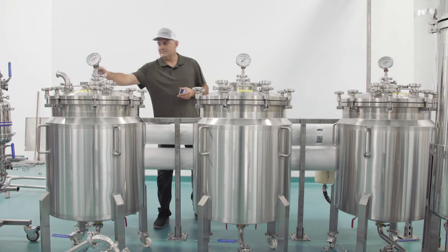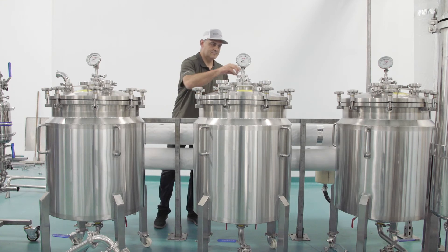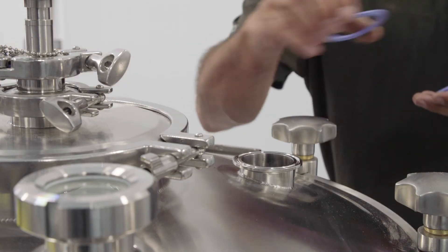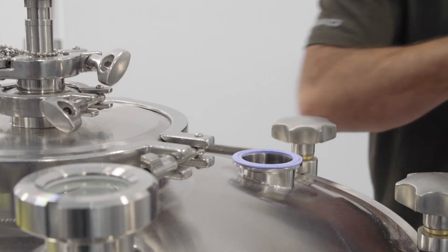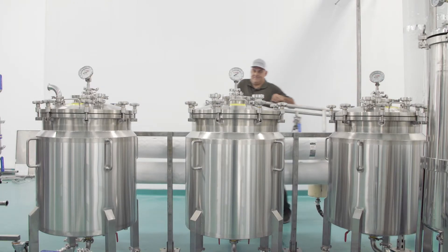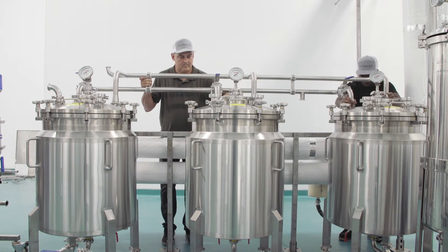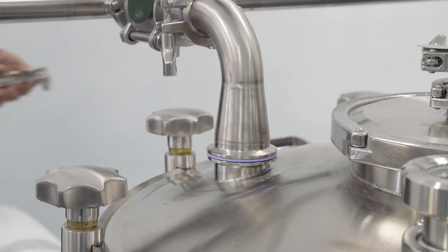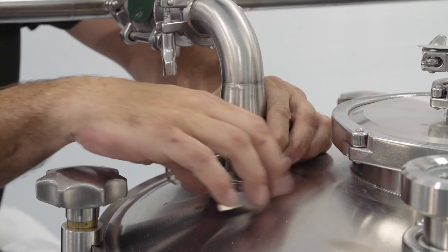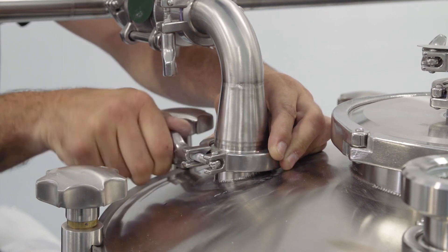Begin by staging the two inch gaskets on the corresponding outlets on the tops of the tanks. Now connect all three tanks using the manifold pipe. Lightly secure the manifold pipe at the six contact points. Avoid overtightening, as slight maneuverability will be required during subsequent steps.